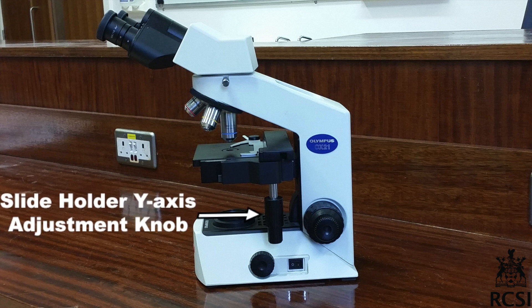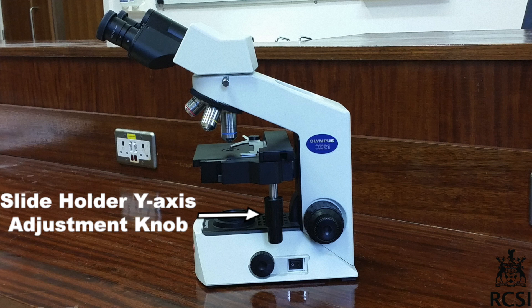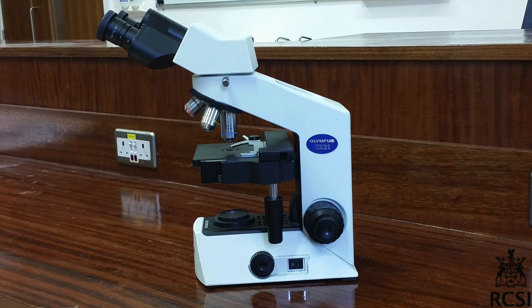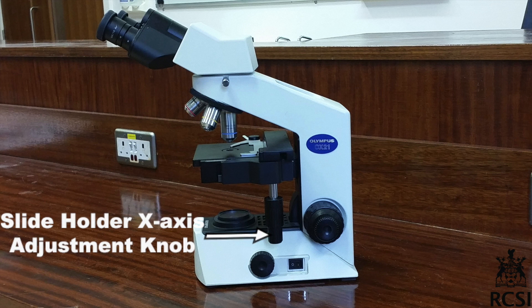The Y-axis adjustment knob moves the slide backward or forward — towards you or away from you. The X-axis adjustment knob moves the slide right or left.